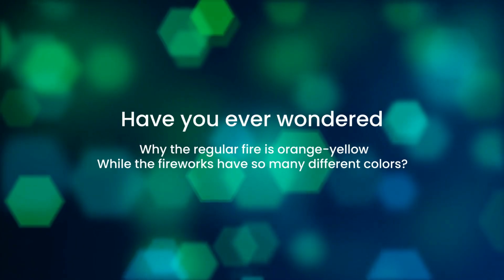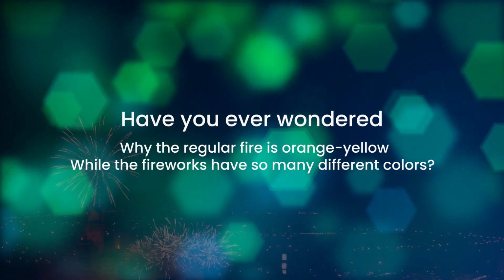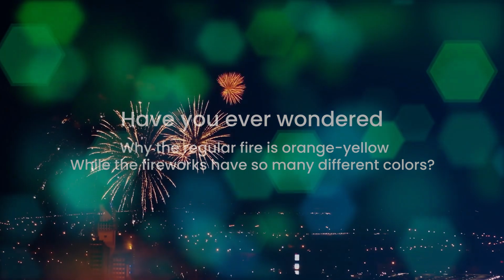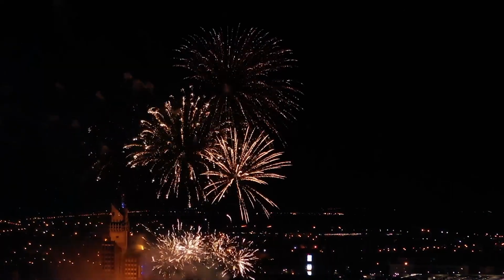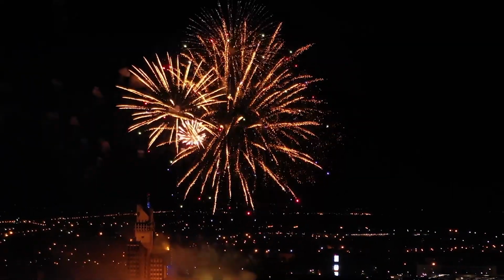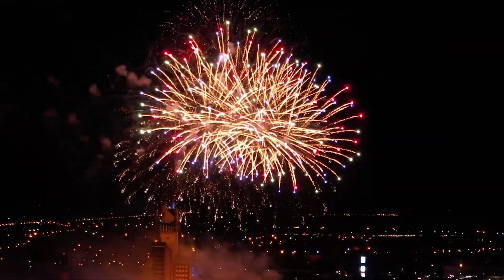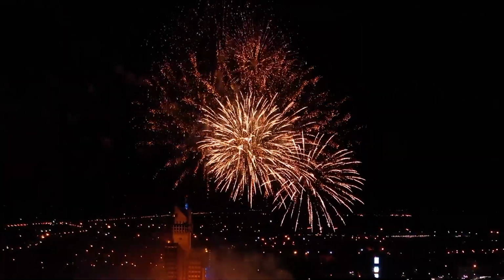I want to ask you this before we begin the demonstration. Have you ever wondered why the regular fire is orange-yellow while the fireworks have so many different colors? Let's investigate that question in the laboratory. Yes, you heard that right. We will investigate the chemistry behind fireworks.